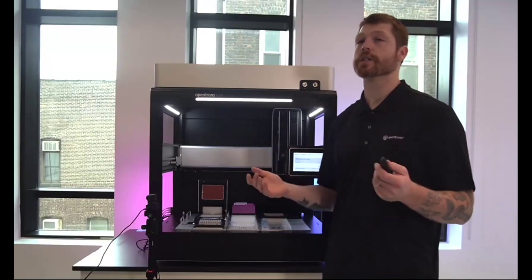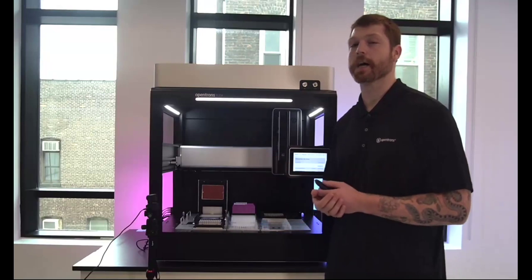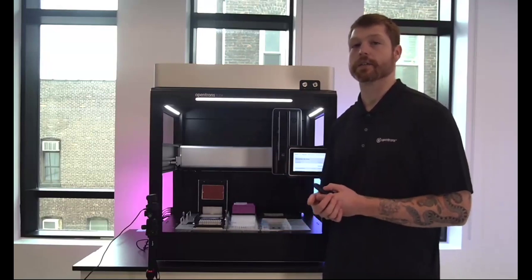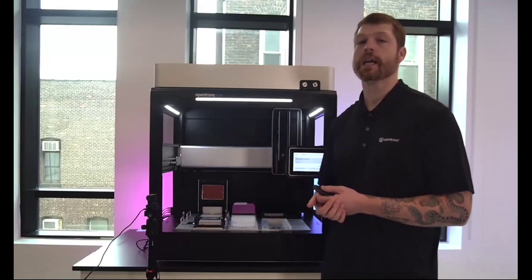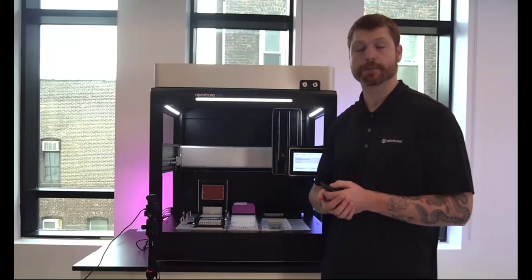That means you can start with the robot at any configuration and with none of these modules and continually add them. Most of the modules are really easy to replace. It's just a few screws and then connecting a USB to the Flex and the power to an outlet. So it's really easy to move between configurations and scale up with your lab space.